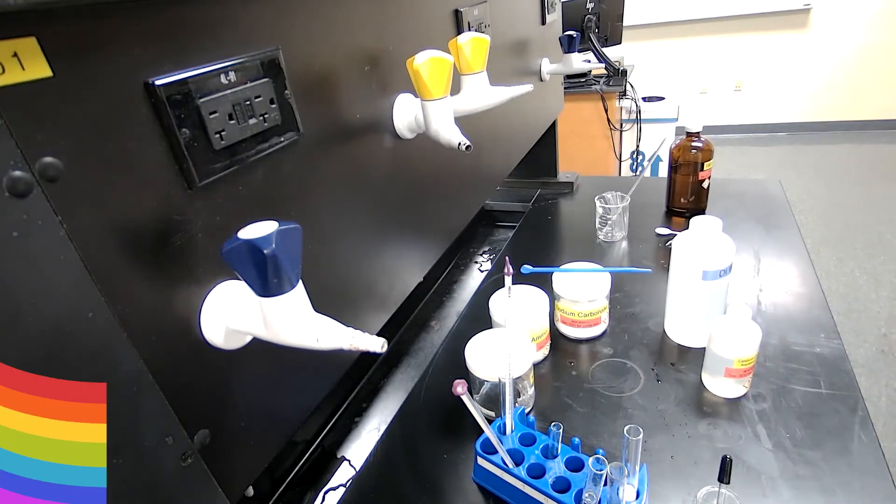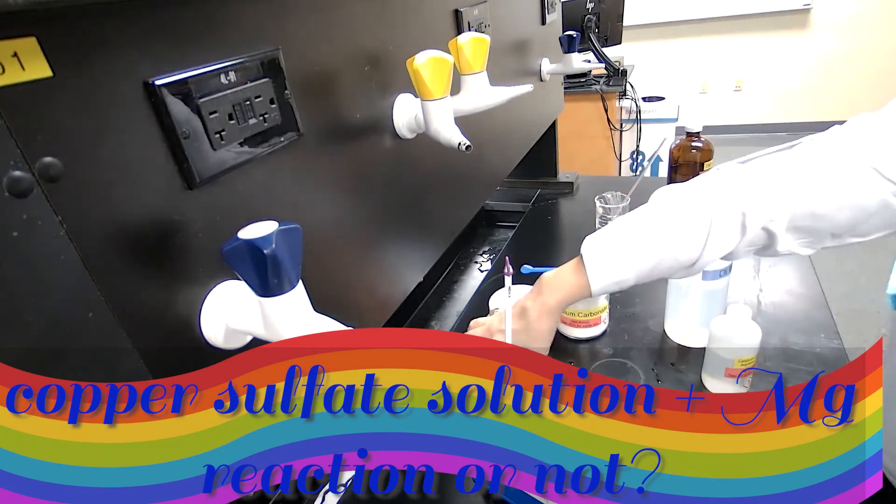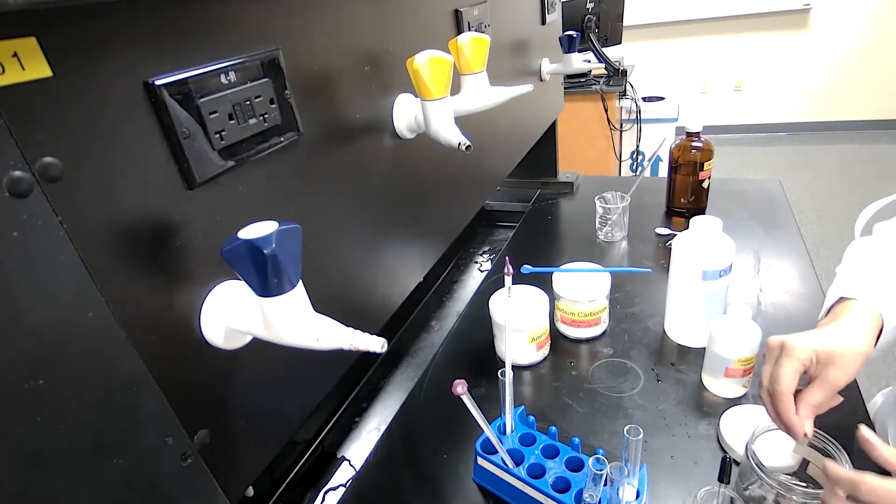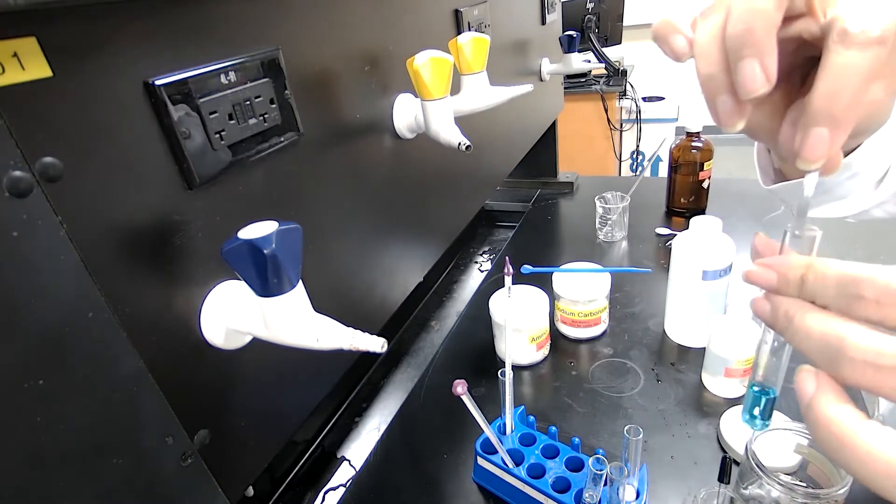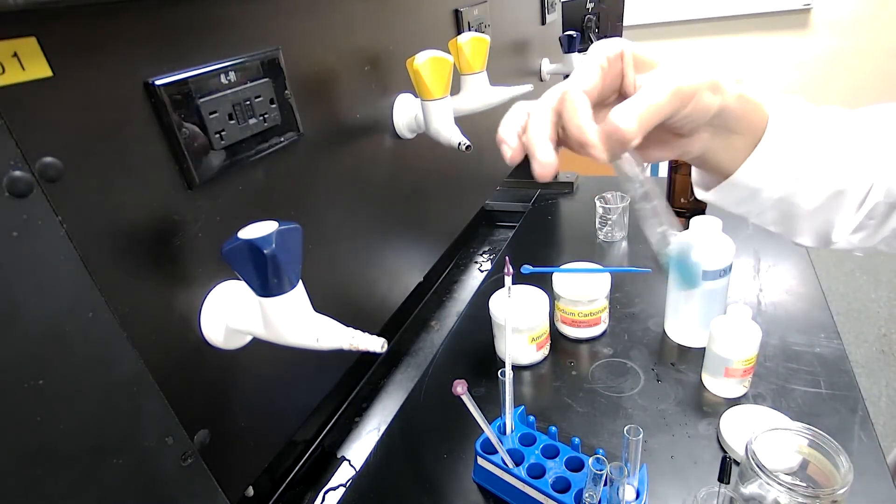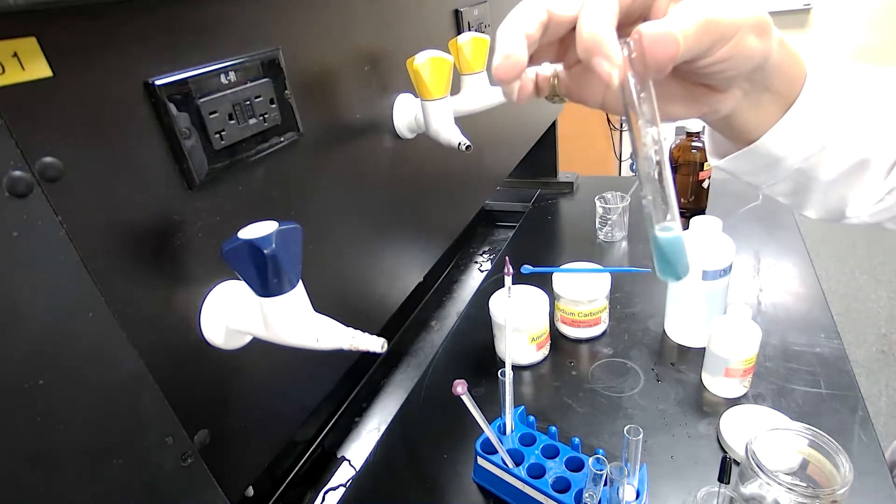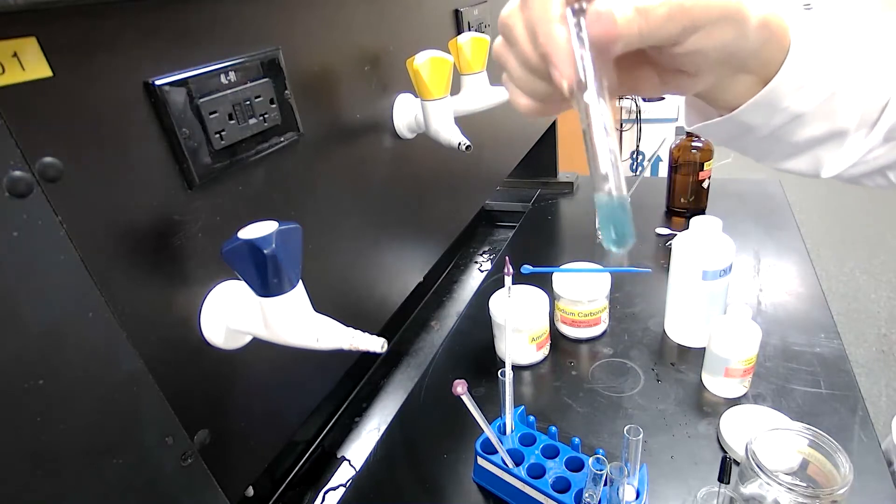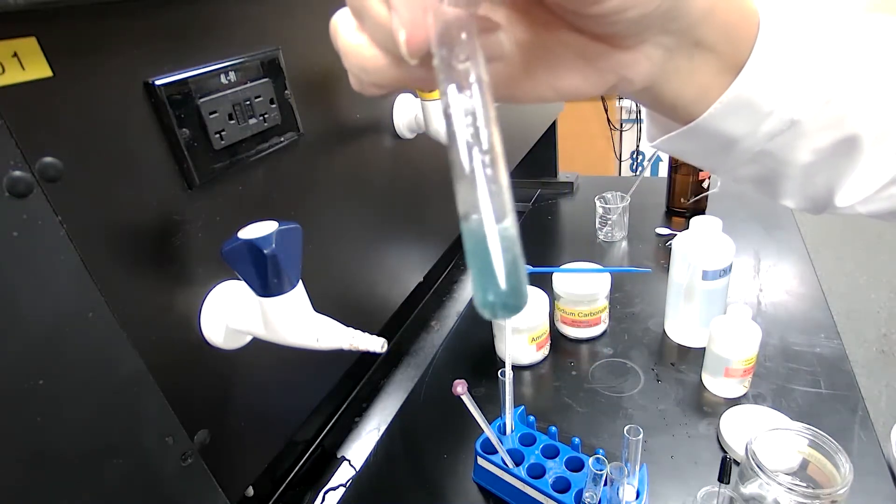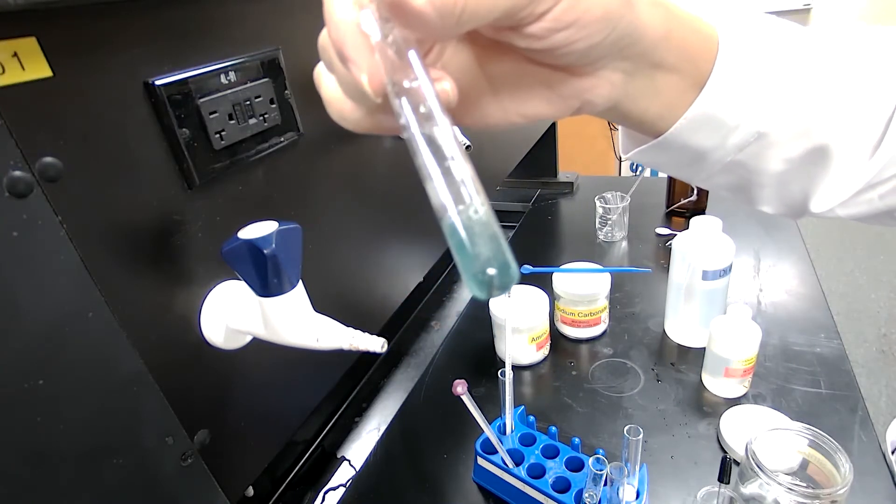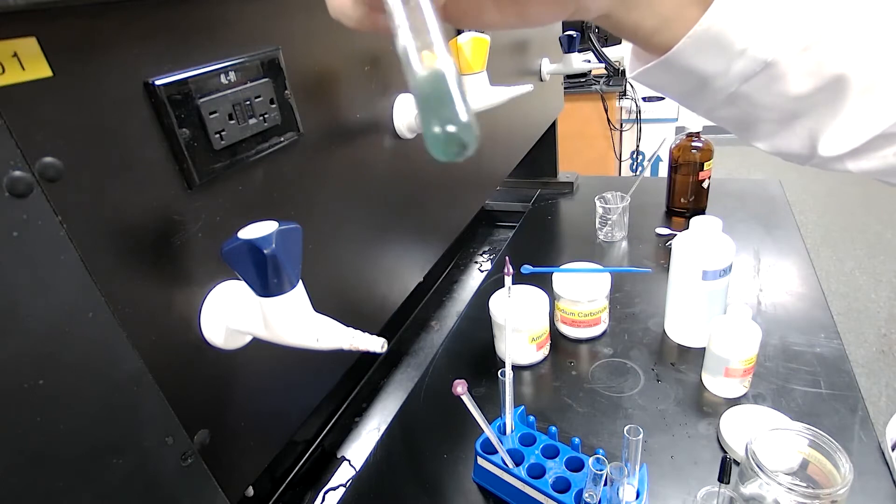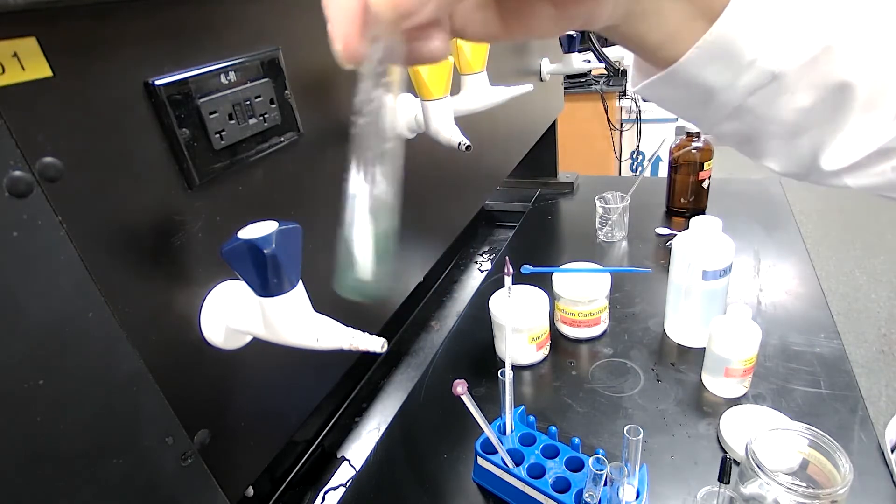For the next step of the reaction, it asks me to use the copper sulfate, blue color copper sulfate solution we have from step two, we saved before. We want to add a piece of magnesium. When magnesium reacts with copper sulfate, which is going to take some time, the blue color of the copper sulfate would disappear. And if you look at the close up, you see some activity is going on now. Magnesium is going into solution. Copper is coming out and you might see those red color particles that are forming. That's basically copper coming out.